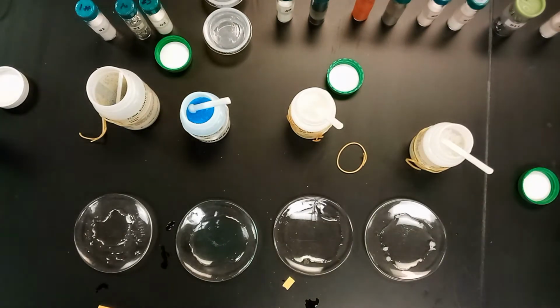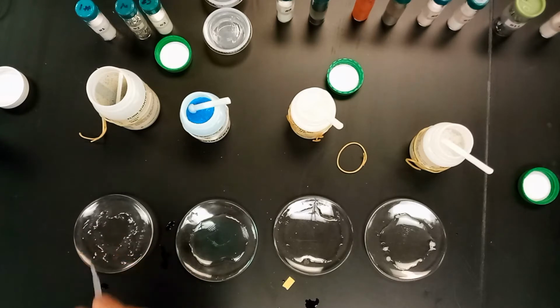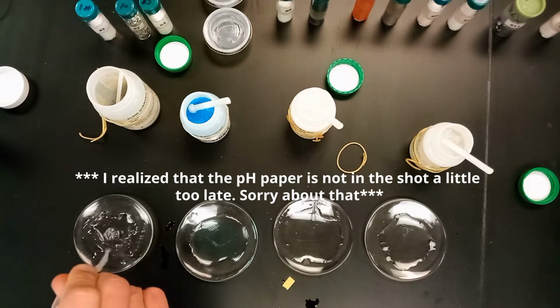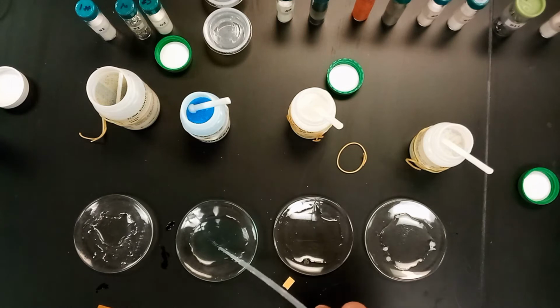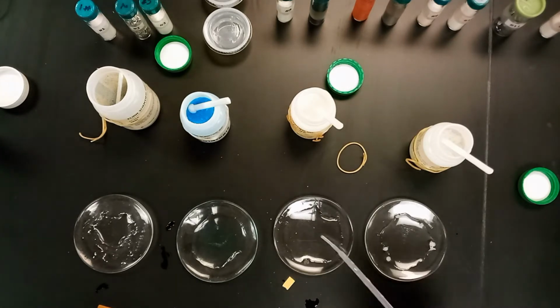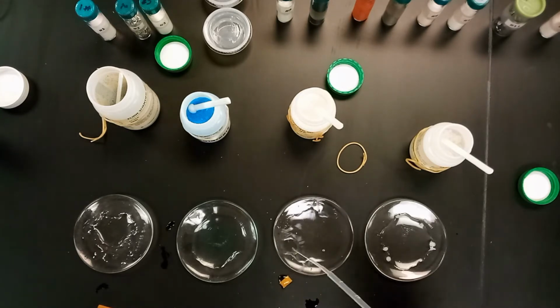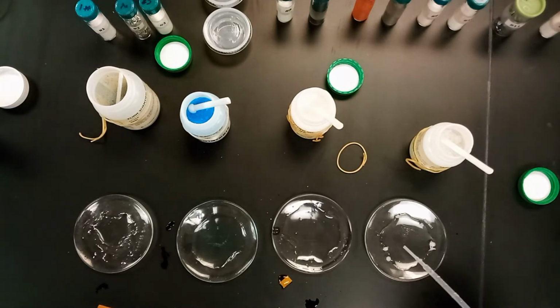Okay, the next thing here that we're going to do is we're going to go ahead and test pH levels from each of these solutions. Even though, for instance, with the zinc one, it didn't dissolve, we're still going to test the pH. Copper sulfate. Dextrose. And the paraffin wax.